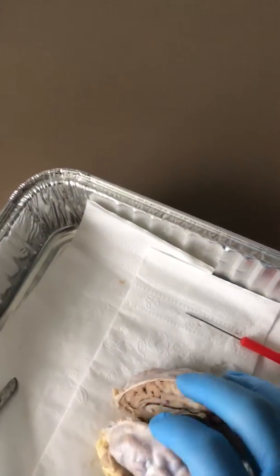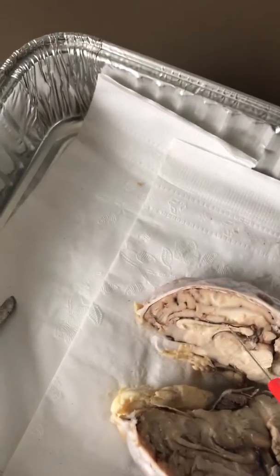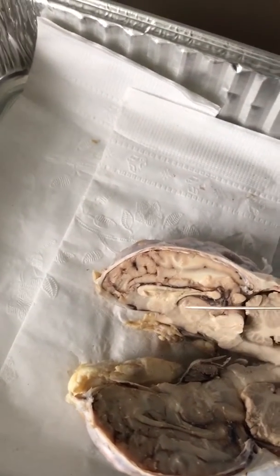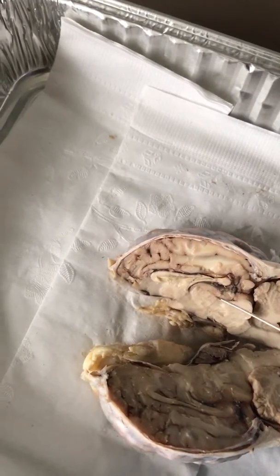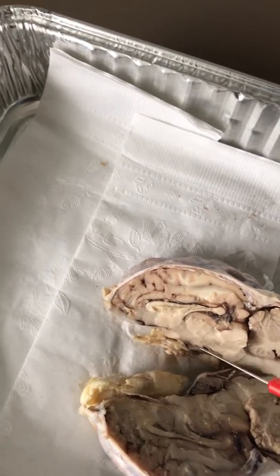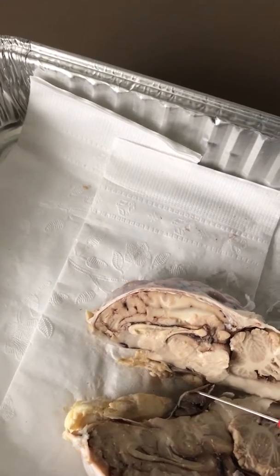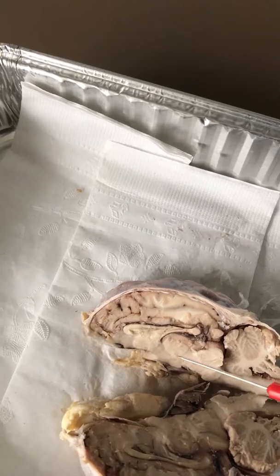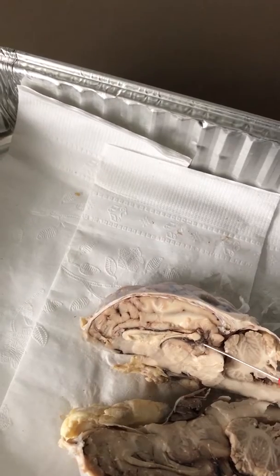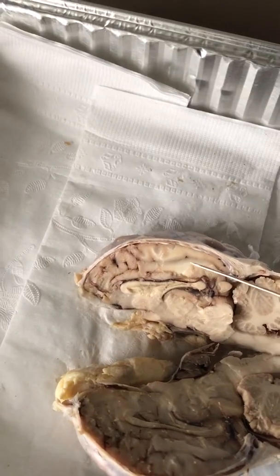Now going inside, you can go inside here. Now we've got the corpus callosum, which is this guy that will basically bridge the cerebral hemispheres together. The thalamus, which should be right here, and then the hypothalamus is down here, which forms the floor. And then we've already talked about the pituitary gland. So the lateral ventricle is this little hollow looking spot here and back in here, which would allow for cerebrospinal fluid.